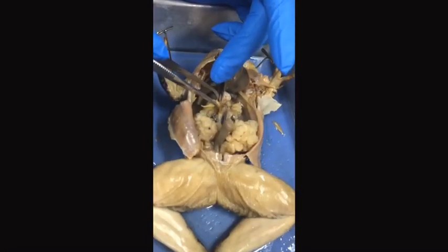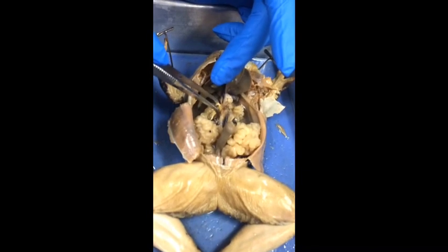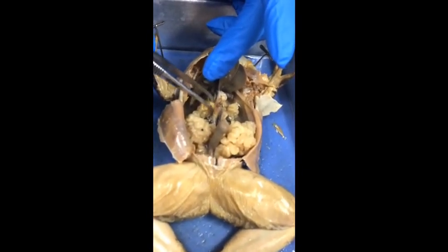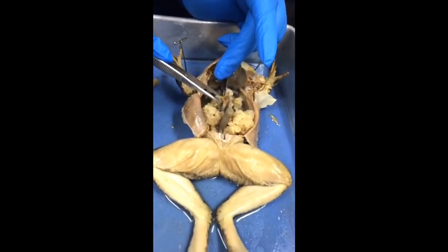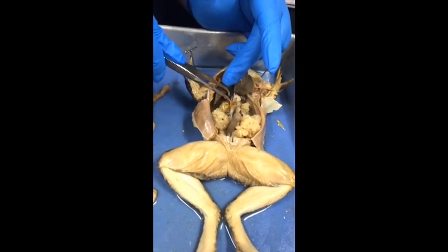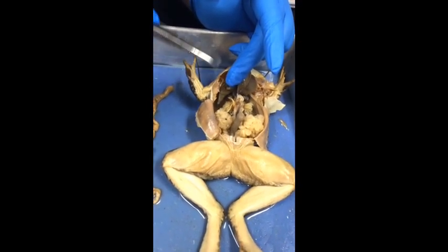These finger-like, spaghetti-like yellow projections are the fat bodies. They are used for hibernation because they help preserve and store extra energy.